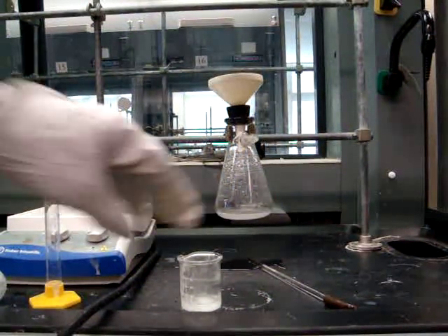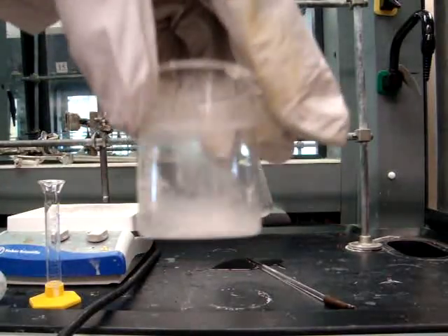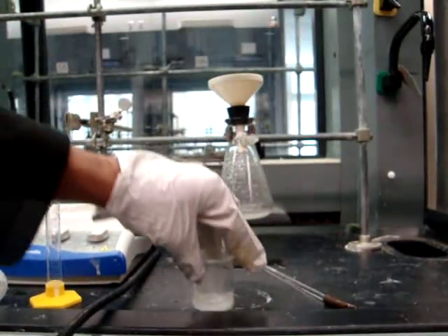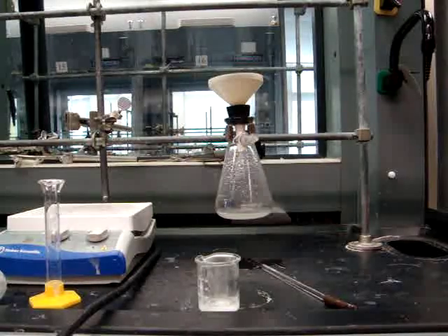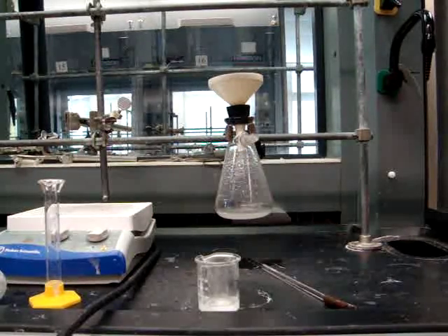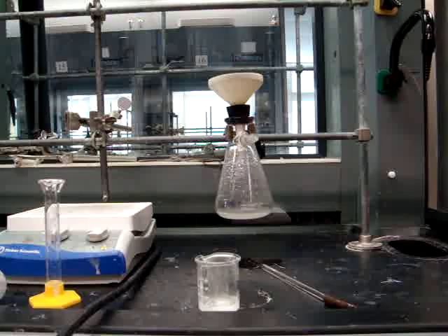Once the solution is dry, you will be filtering this into a collection flask using a cotton plug. For more information about this kind of filtration, refer to the chromatography videos.